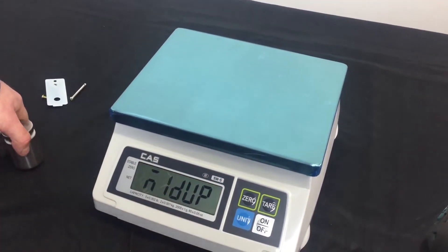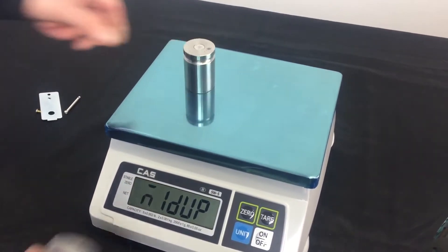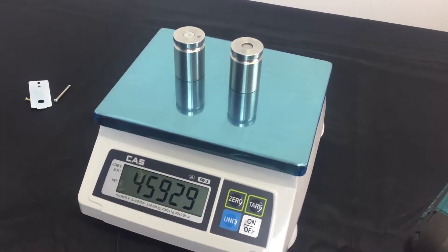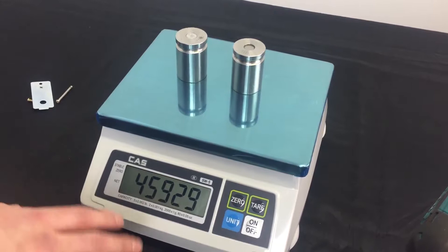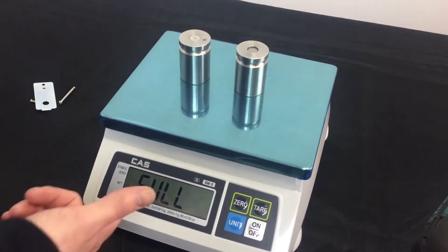Now, you put that middle weight that you just set up in the Cal 10, which is two pounds for our scale today. So, I'm going to place two pounds on the platter. After I have my two pounds on, I'm going to press the zero key again. It shows your raw counts. Bounce around right around the same number, which is good. Then, it'll move on to full.